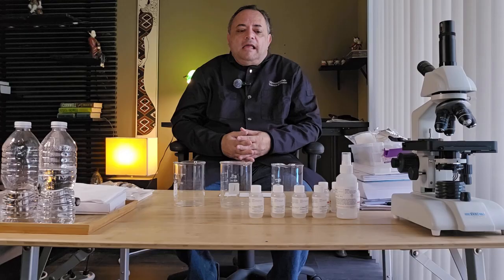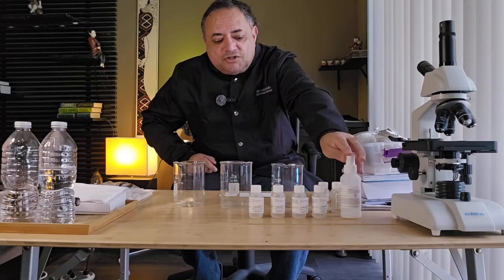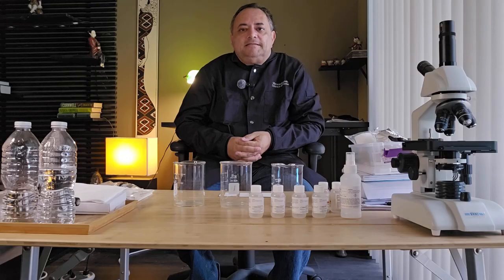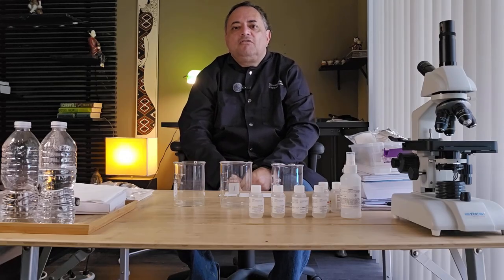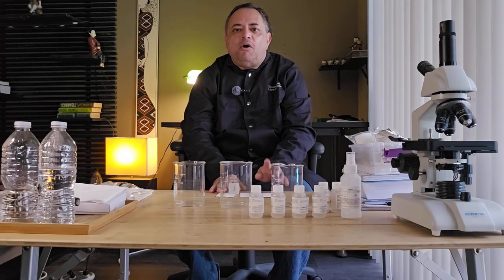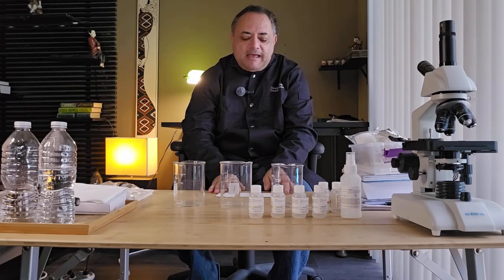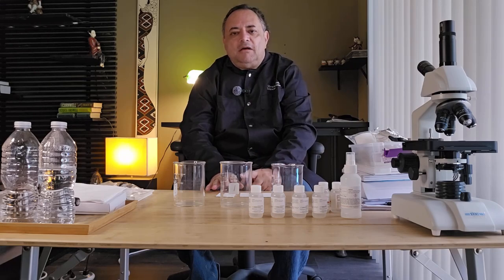In addition, I have ninhydrin powder, which I'm going to reconstitute in alcohol just before I need to spray my plates. What I'm going to do is have 3 separate plates, and on each plate I'm going to spot one of the amino acid controls that we have, and then I'm going to spot the unknown sample on each of the 3 plates as well.